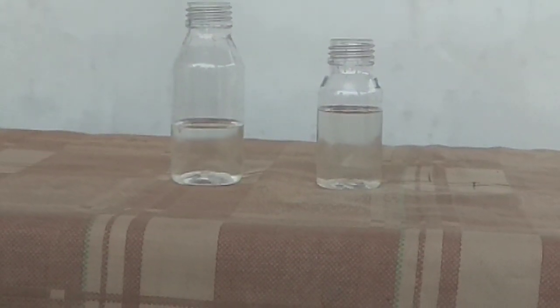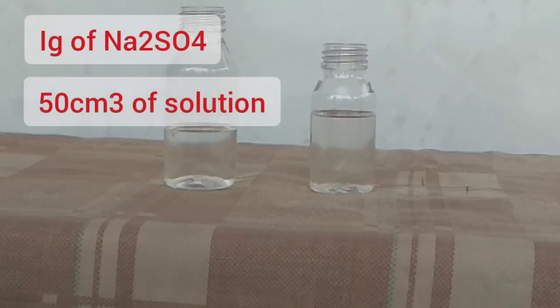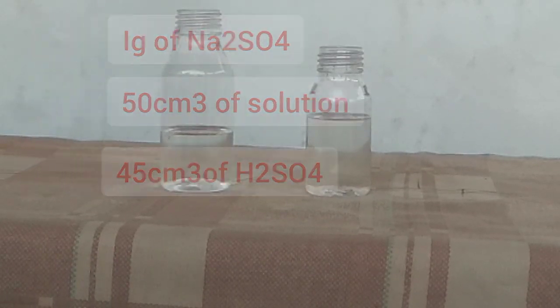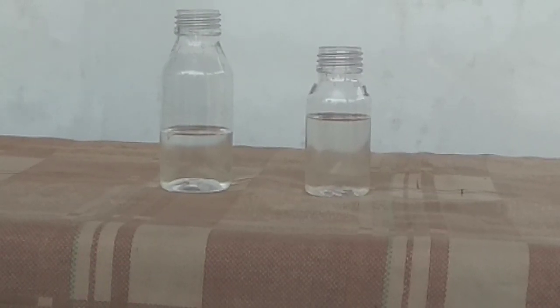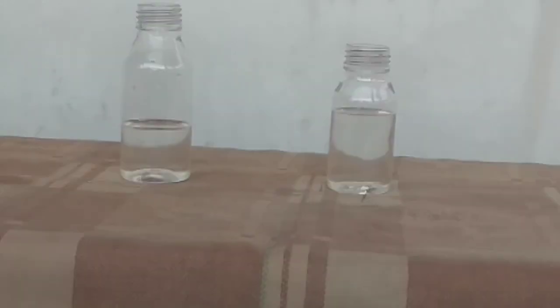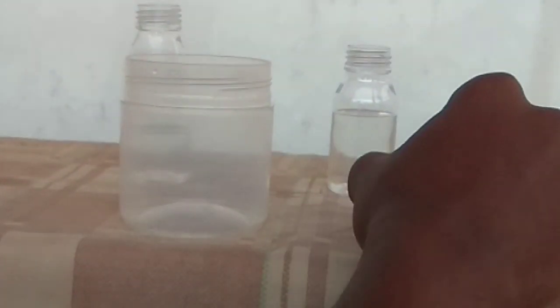A quick test with the values that I gave you — one gram of sodium sulfate, 50 cm³ of solution, and 45 cm³ of sulfuric acid — can you tell me the concentration of my sulfuric acid here? When you do, you can write it in the comments below. For the reaction to occur, we simply have to mix the two solutions together.